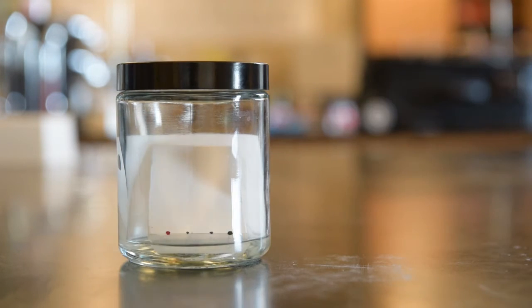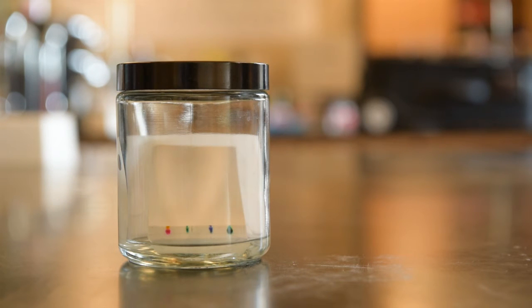You are looking at the motion of the solvent line up the plate. This is the motion of the mobile phase through the stationary phase. The solvent line will rise quickly at the beginning and more slowly towards the end. Wait until the solvent line reaches about 1 centimeter from the top of the plate.